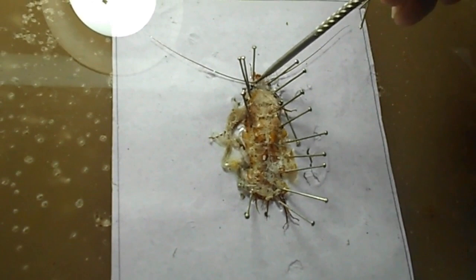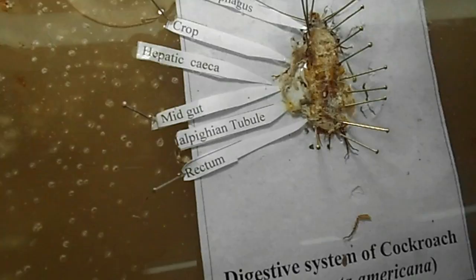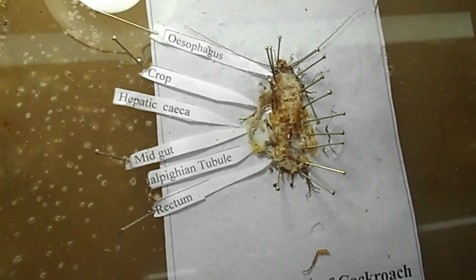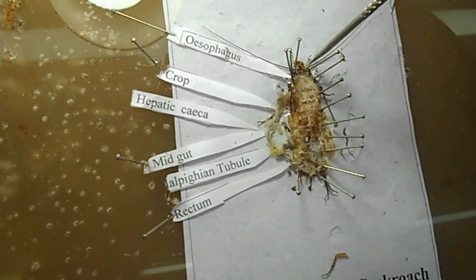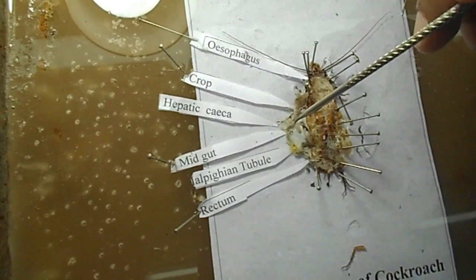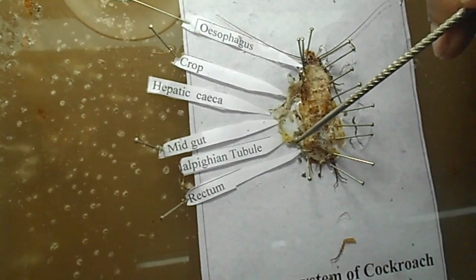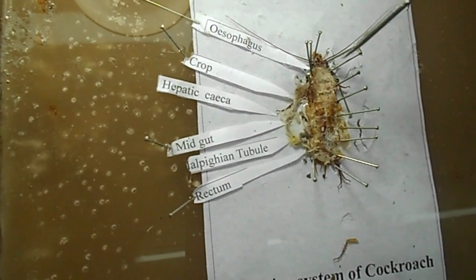For better presentation, you may label it. I show you how we can label during dissection — this is called flag labeling. First, write the names of the various parts of the digestive system. For example: this is the esophagus, this is the crop, these are the hepatic caeca. The space between hepatic caeca and Malpighian tubules is called the midgut. These greenish, yellowish color tubules are the Malpighian tubules. The last elongated part is the rectum, and this is the anal passage. You may also label the salivary apparatus and so on.